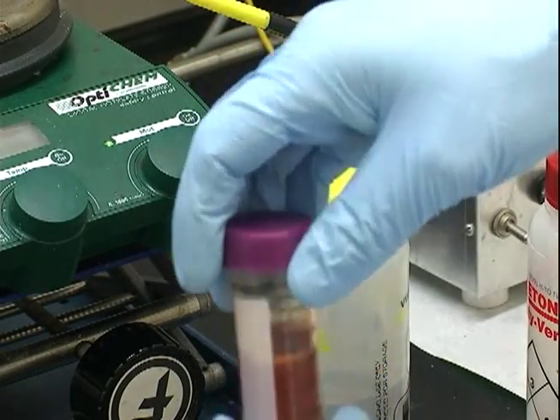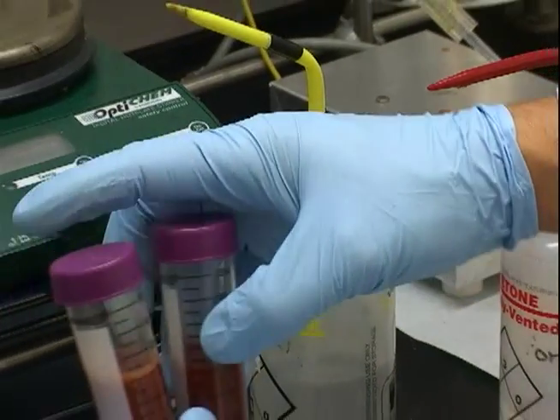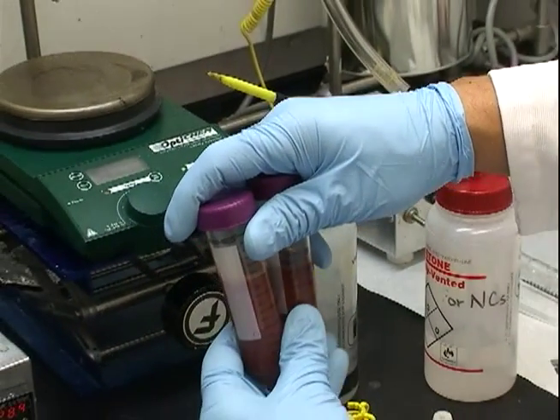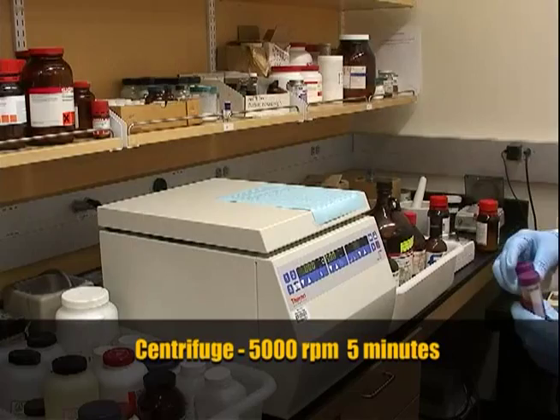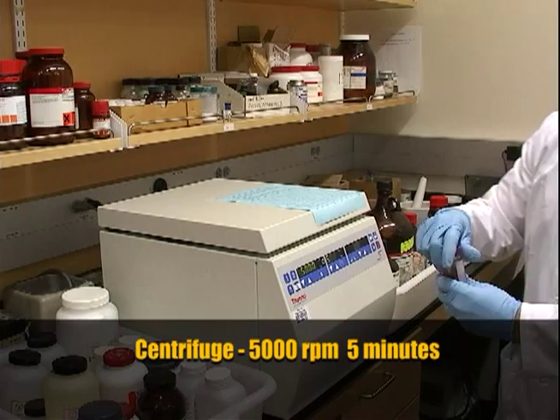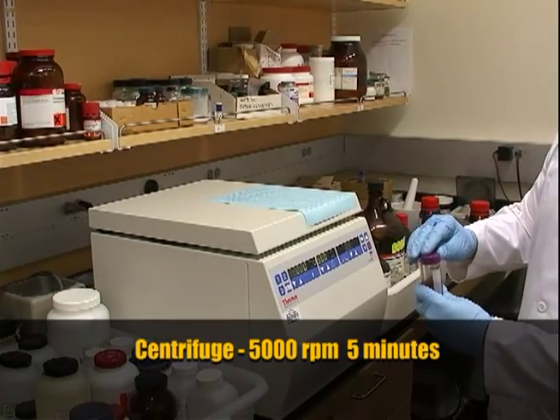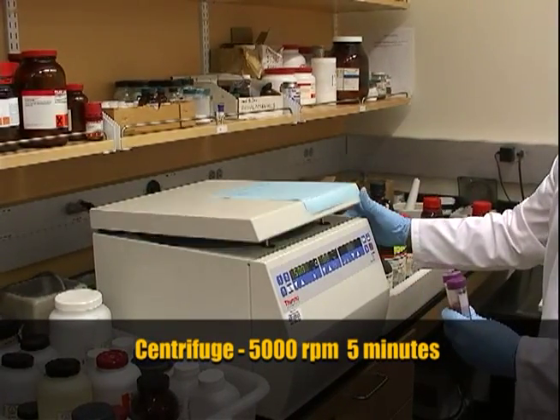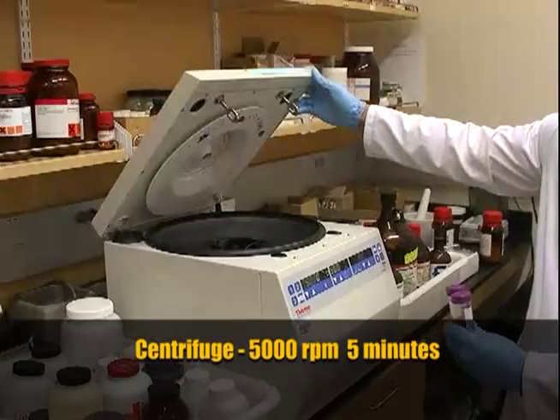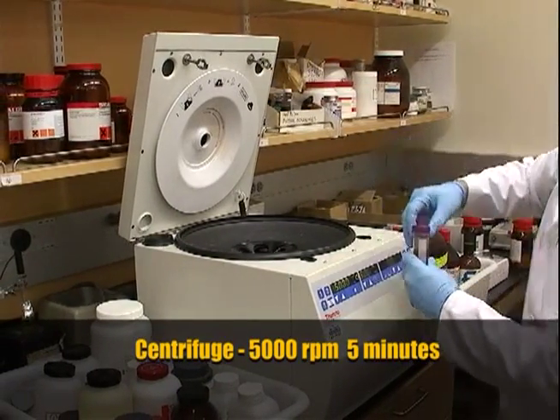Now we'll take these vials over to the centrifuge and spin them down at 5,000 RPM for 5 minutes. If you're careful, your tubes are already balanced; if not, you need to balance them before spinning. We'll be spinning at 5,000 RPM for 5 minutes.